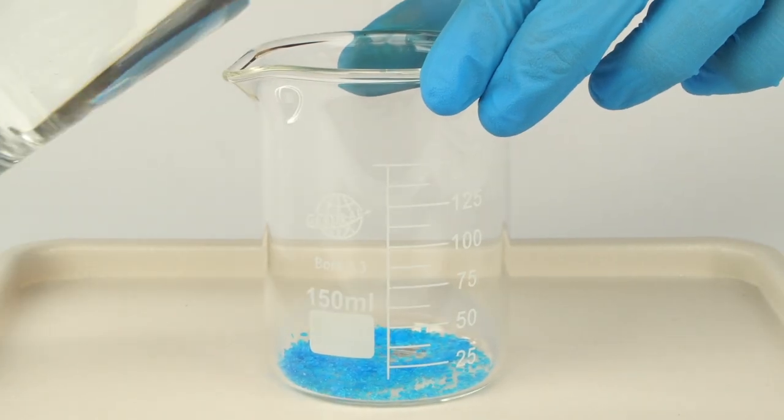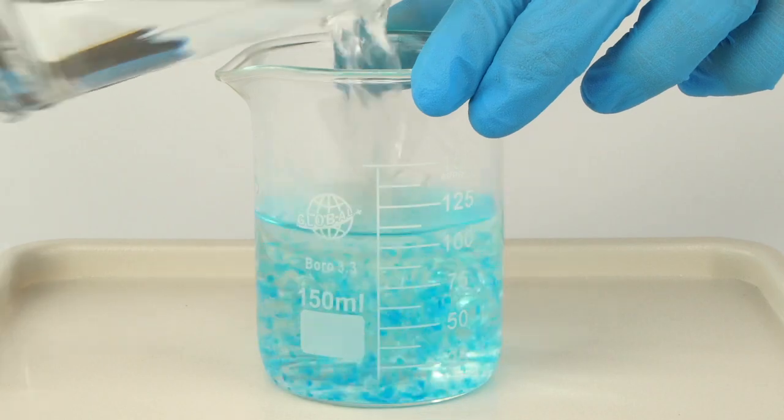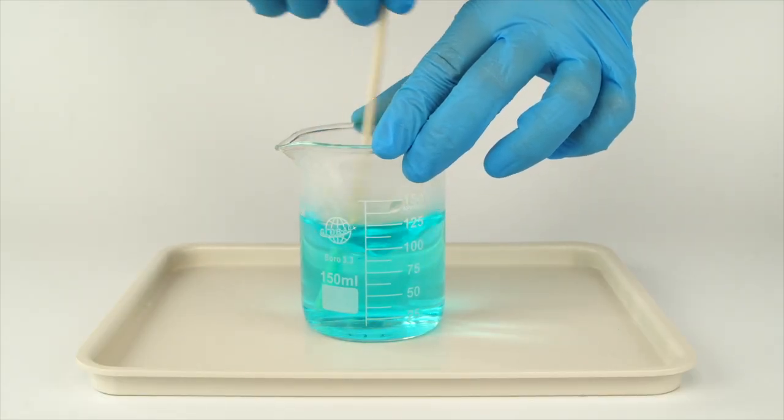Add boiling water to the 100 milliliter mark. Stir the solution with the wooden stick until all the crystals dissolve.